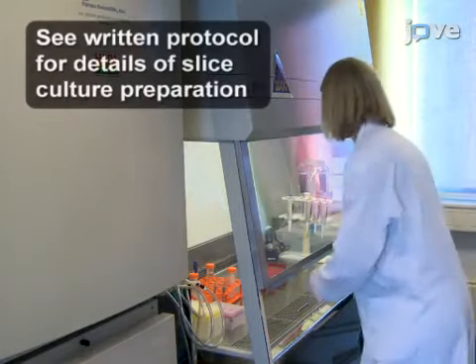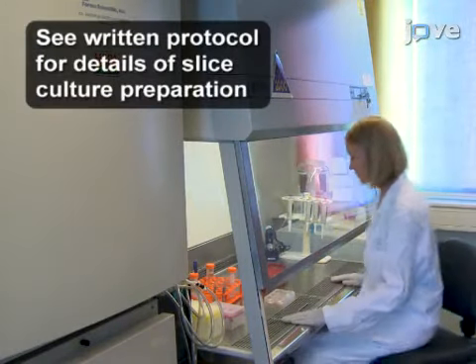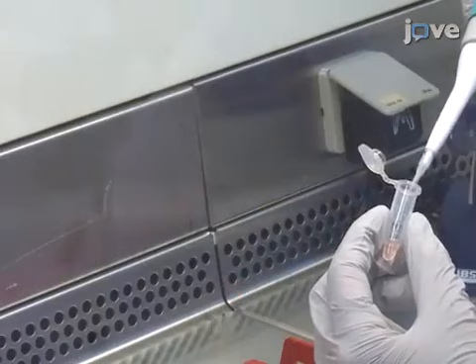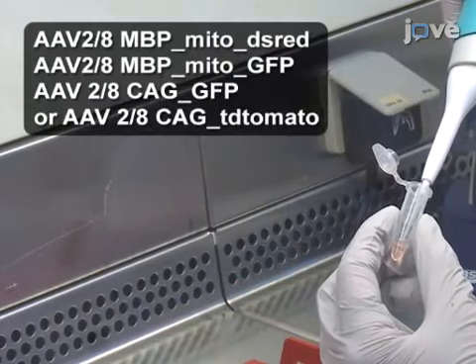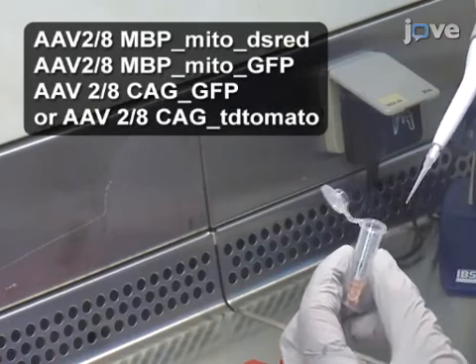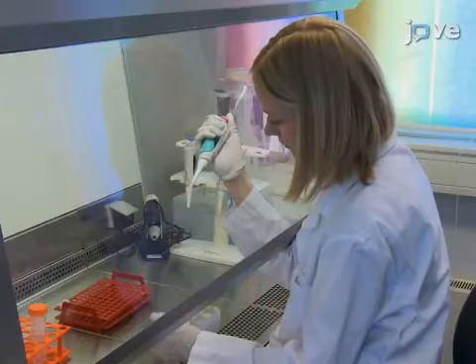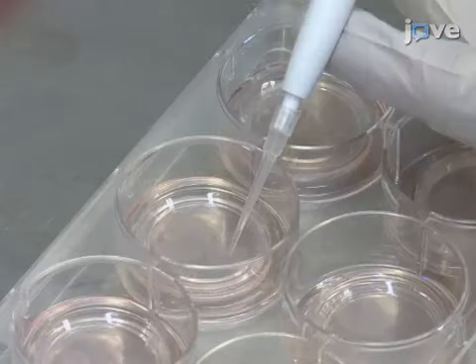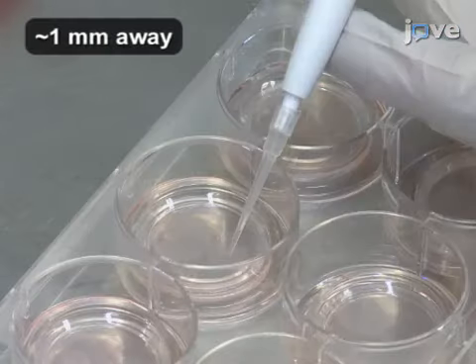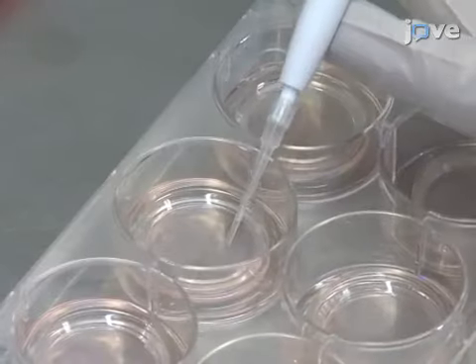Transduce oligodendrocytes in slice cultures at day 7 in vitro. First, draw up 1.3 microliters of diluted AAV per slice. Making sure the outside of the pipette tip is dry, hold the pipette above the cortex as close as possible without touching the slice with the pipette tip, and slowly push solution out of the pipette.